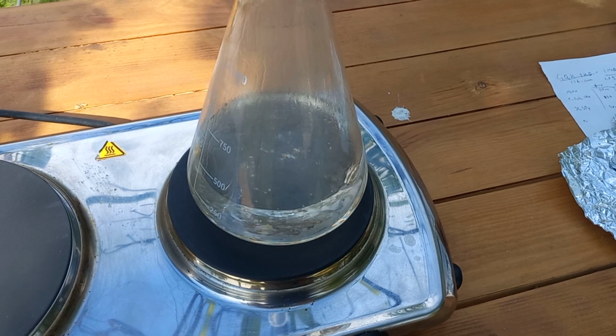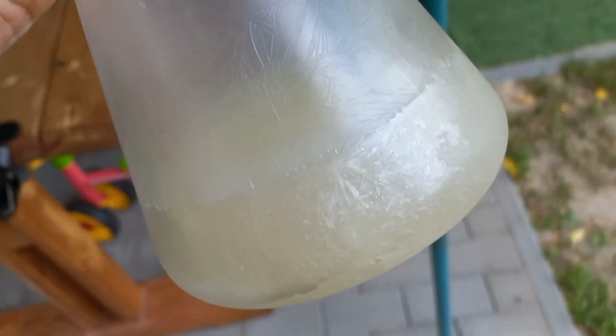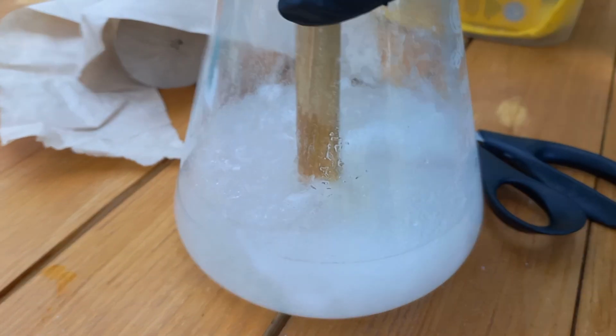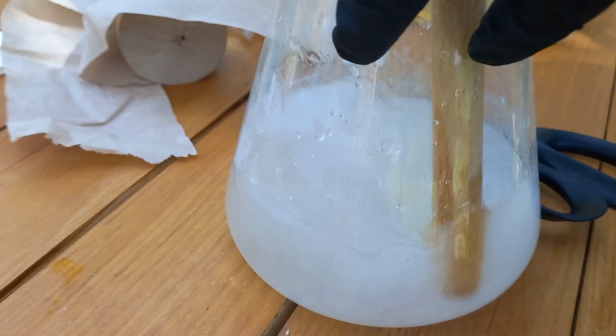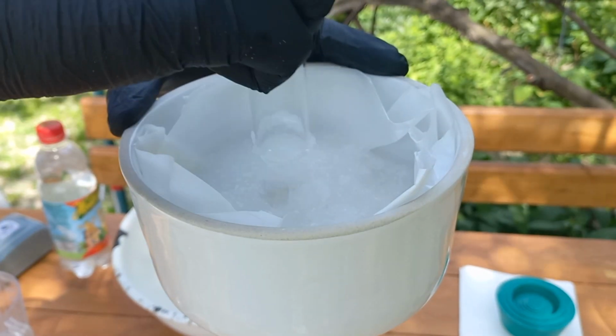Afterward, I cooled the mixture in the fridge for a day. A large amount of crystals precipitated from the cooled solution, making it challenging to crush them. I used suction filtration to separate the crystals from the liquid, and washed them with ice-cold methanol. Then I dried them for half an hour.